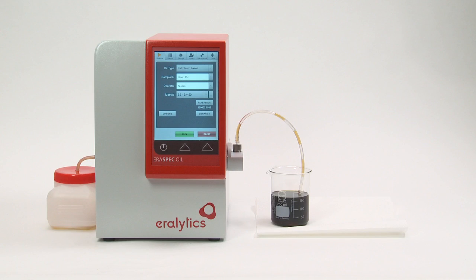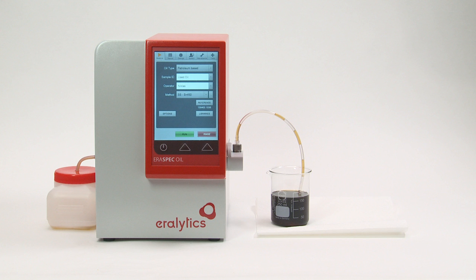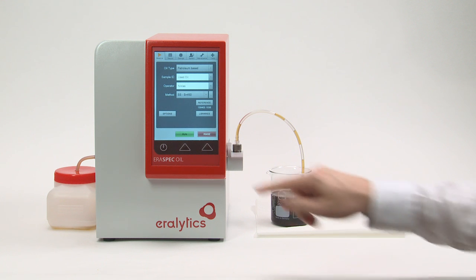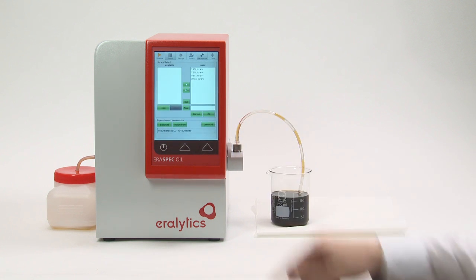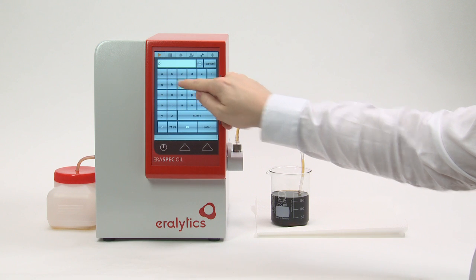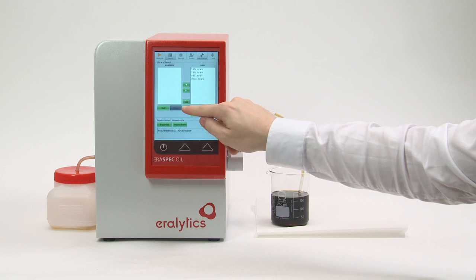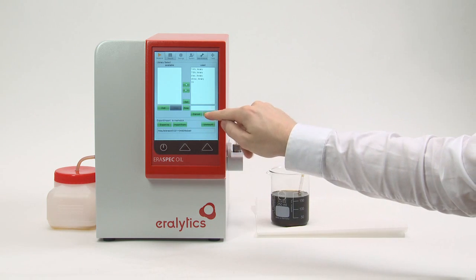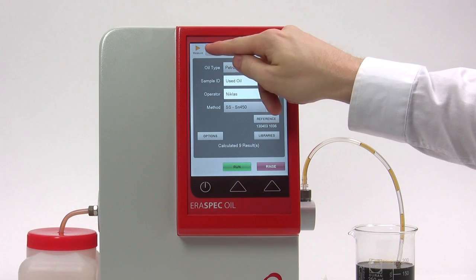For the best accuracy, it is recommended to create new libraries with your specific samples. To create a new library, click Libraries in the Measure menu, enter the name of the new library, and press the button New.